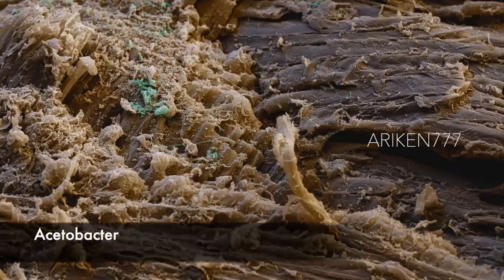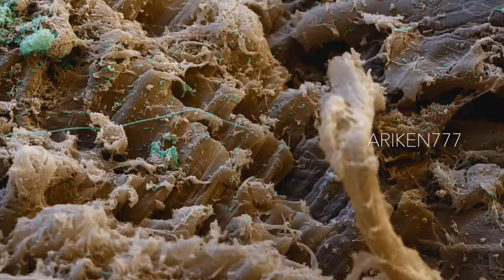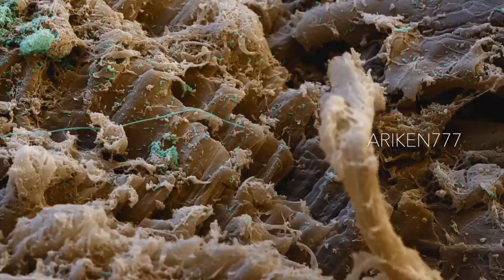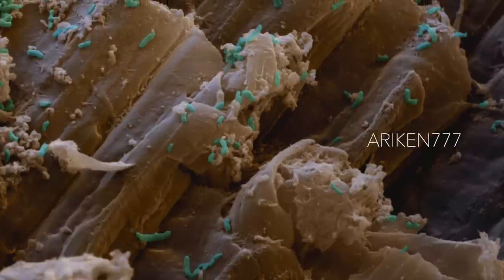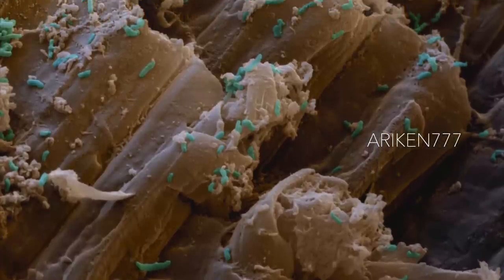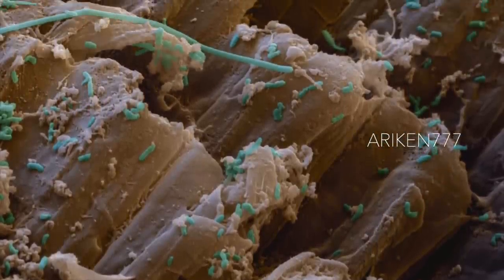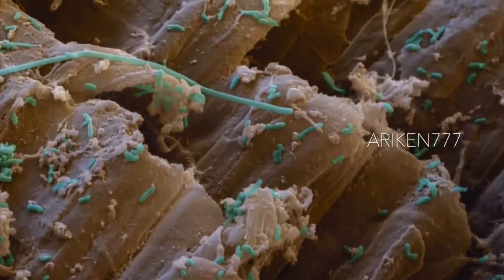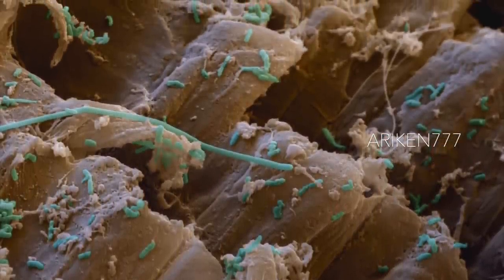Acetobacter is a genus of bacteria which oxidizes ethyl alcohol to acetic acid. Acetobacter is used in the manufacture of vinegar, grown as a film on the surface of beer wort, pickled brine, and fruit juices, when they are commonly known as mother-of-vinegar.